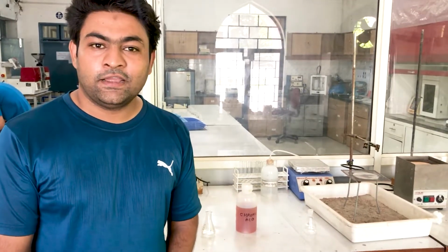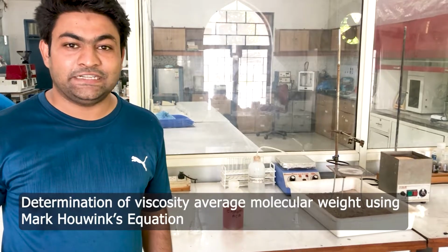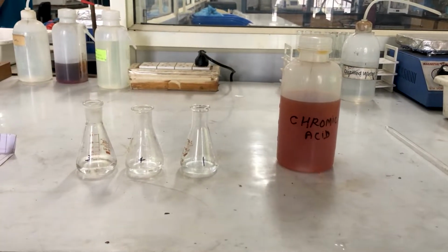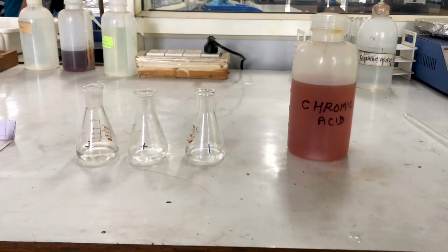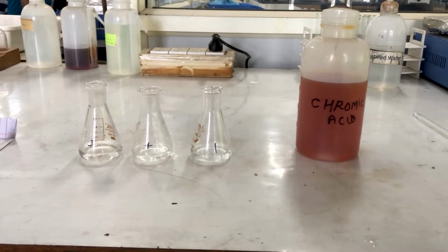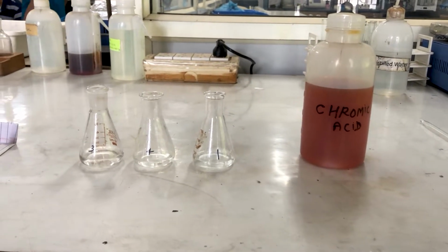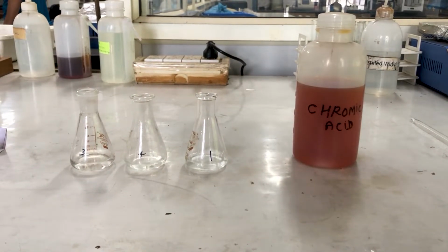Hello everyone. Today I am going to demonstrate the experimental determination of viscosity average molecular weight of a polymer. The molecular weight obtained by this technique is viscosity average molecular weight. The viscosity of polymer solution is considerably high compared to that of a pure solvent. The increase in viscosity is attributed to the giant size of the polymer molecule or chain.